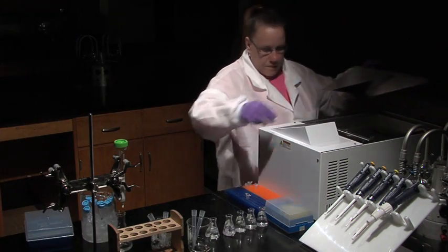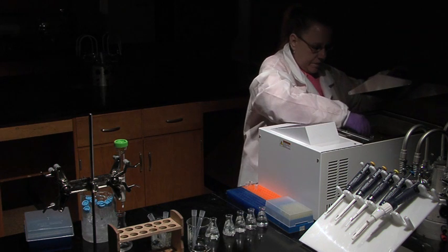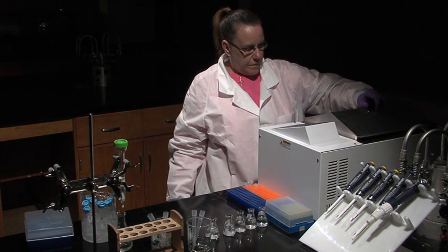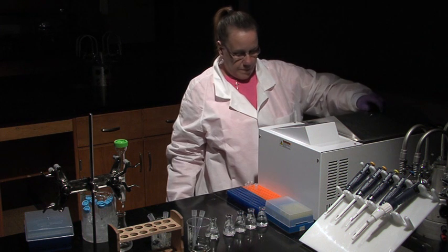Place them in a 37 degree water bath for 15 minutes. When the samples are ready, they'll be loaded into an electrophoresis gel to compare the three samples.